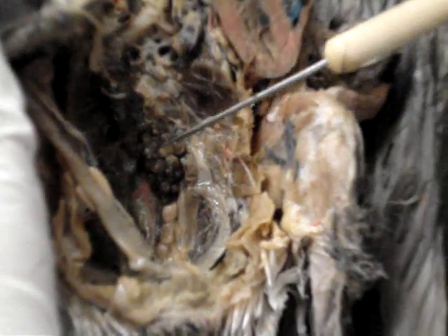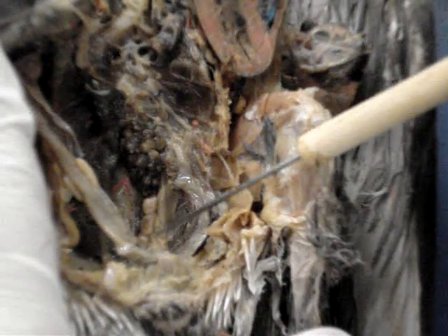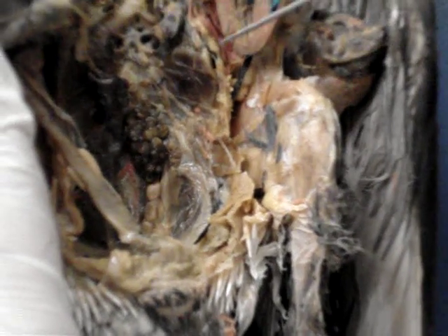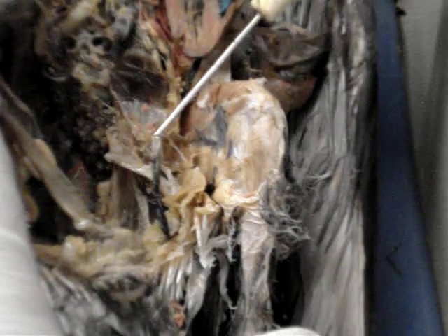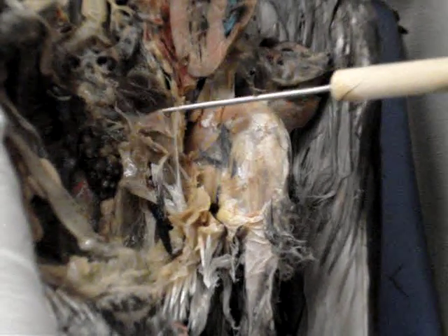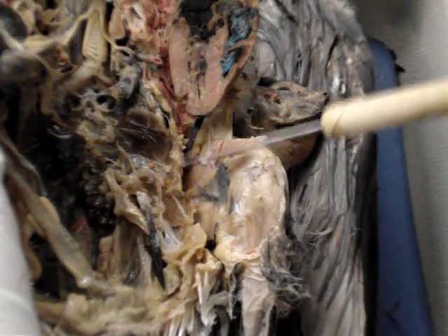This being the other bird, we can see this mass as the ovaries. Underneath it, the oviduct leading to the cloaca. The air sacs are here, near the lungs, beneath the air sacs. Is it for protection?